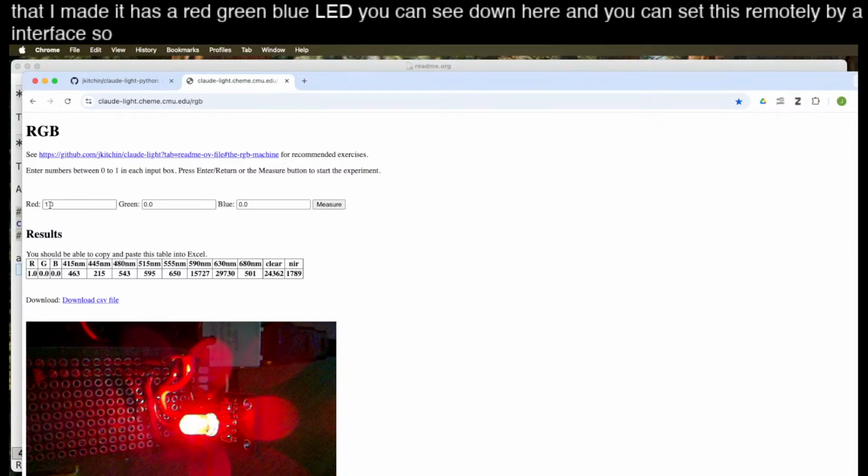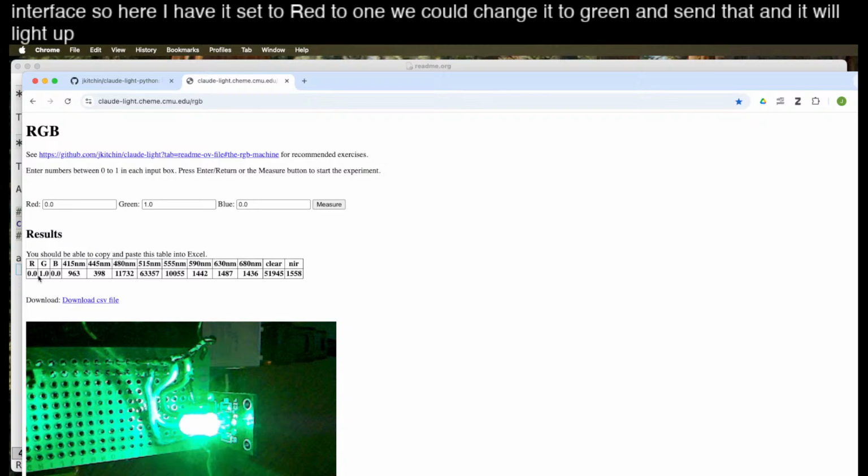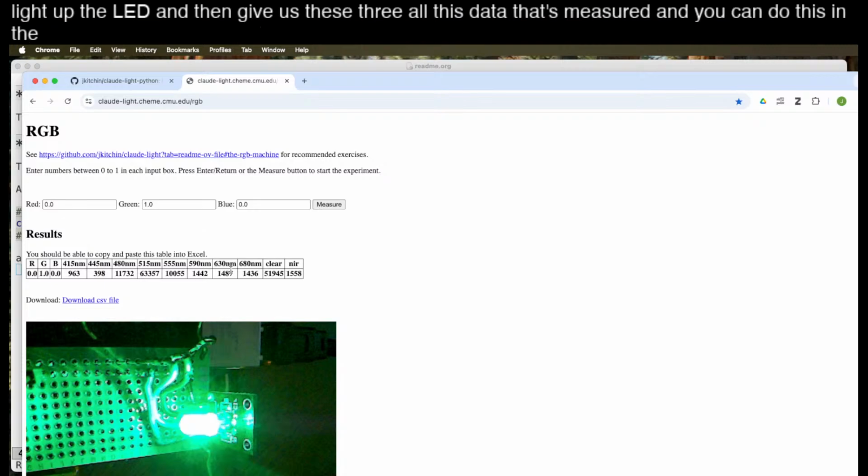So here I have it set to red to 1. We could change it to green and send that, and it will light up the LED and then give us all this data that's measured. And you can do this in the browser. You can also use a Python API and run it through Notebook.